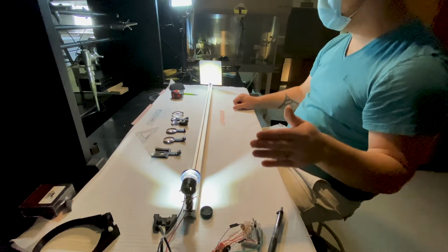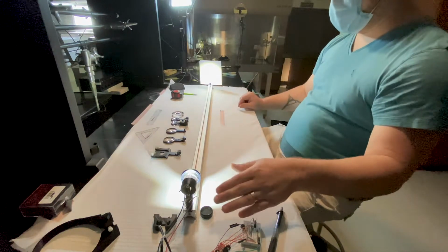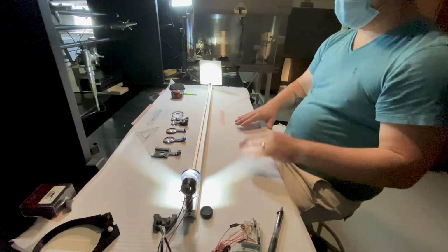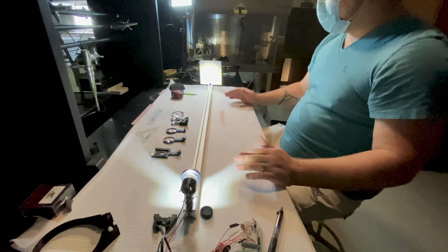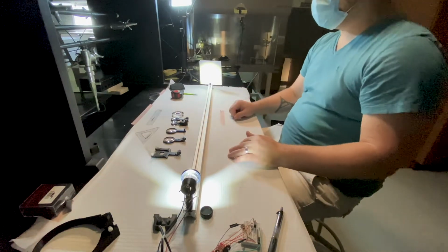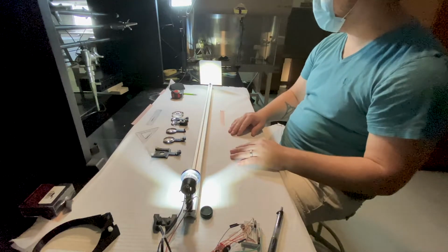If you want to take diverging light and collimate it, mount your light source one focal length away from a lens. Okay? So this is a very basic, even illumination setup. We will go into more advanced stuff with Kohler, which will require more of these lenses, but for right now, this is what we need.